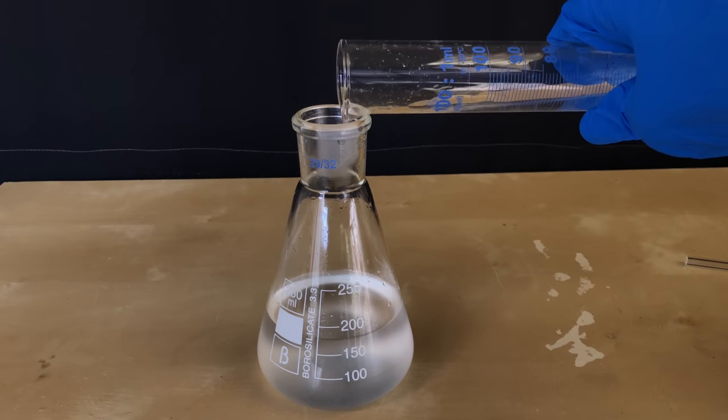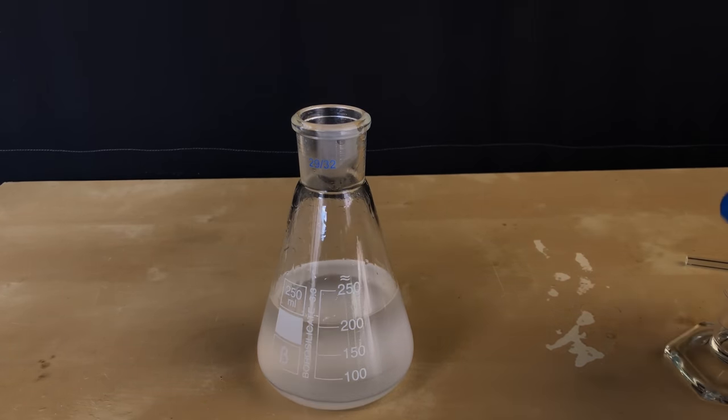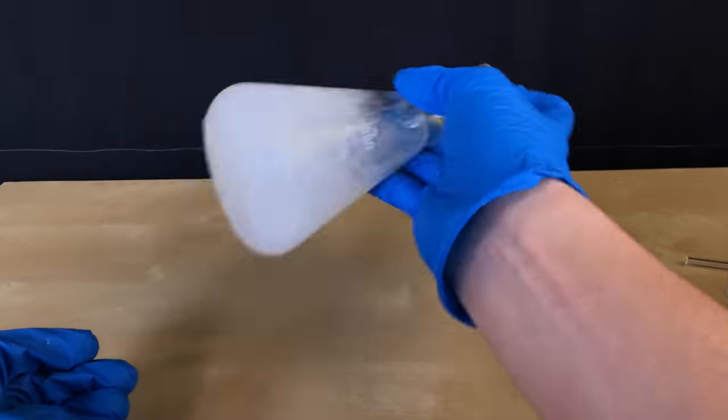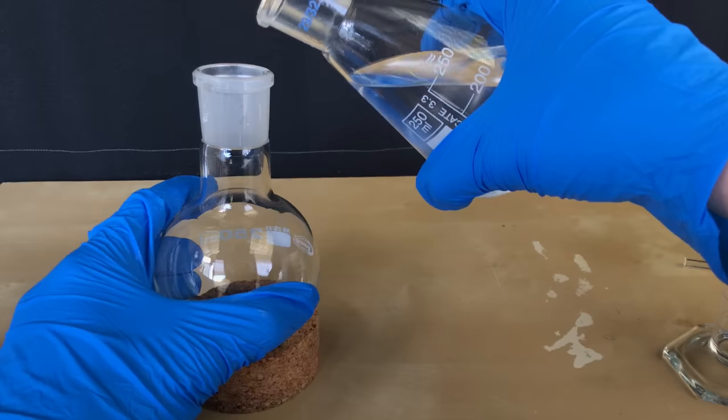To the combined ether layers in this flask, about 50 ml of distilled water were added and the flask was kept in shaking. If any DMF dissolved into the ether, we should be able to get rid of it in this step.